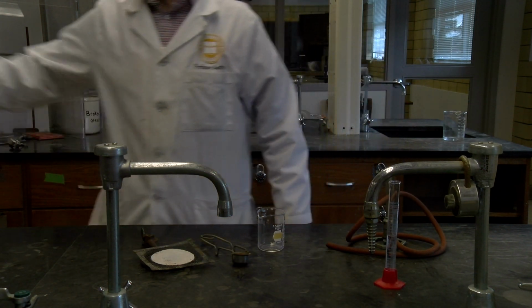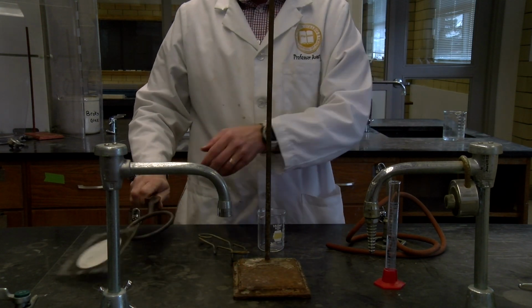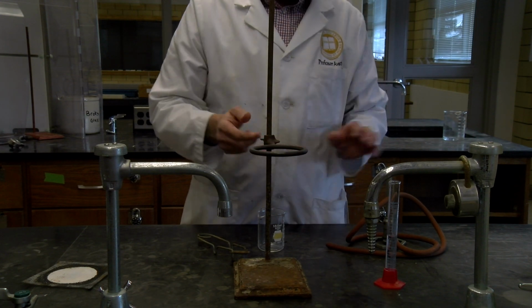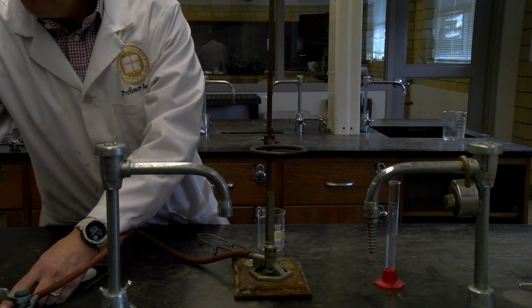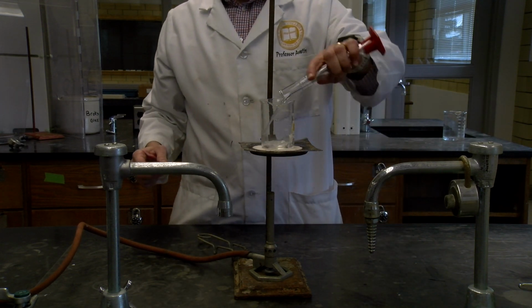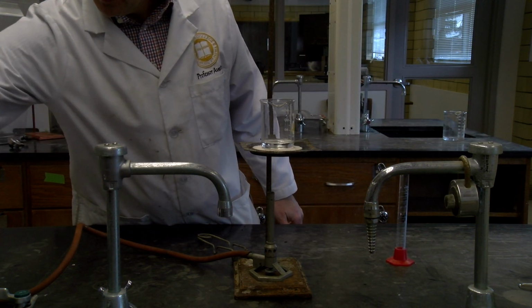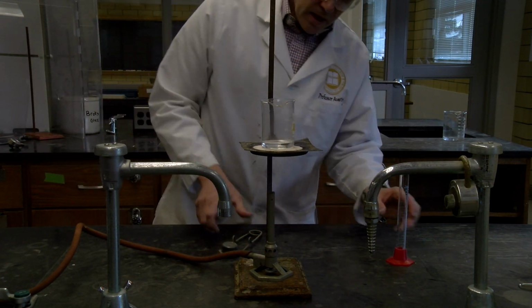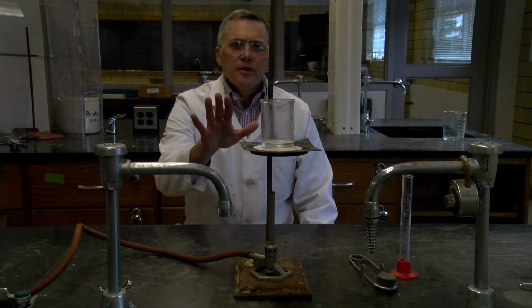Going to make sure that we have about as much room as we need. All right, so I have this. So we put 15 milliliters of water in there. Of course, turn on our Bunsen burner. All right, and we got that set, and we'll go lay out the maleic anhydride while this heats up.